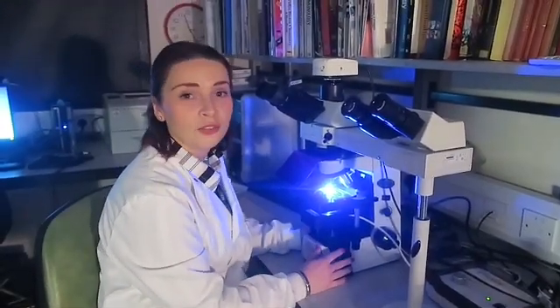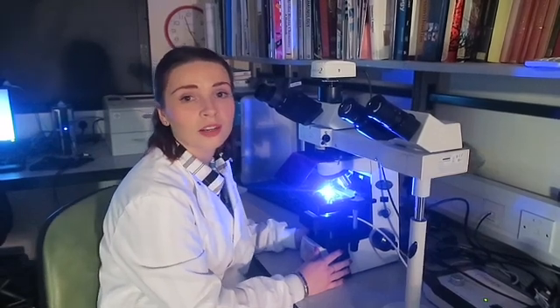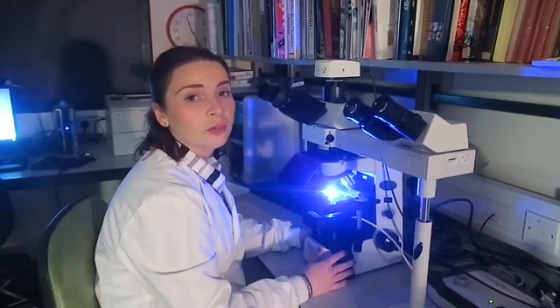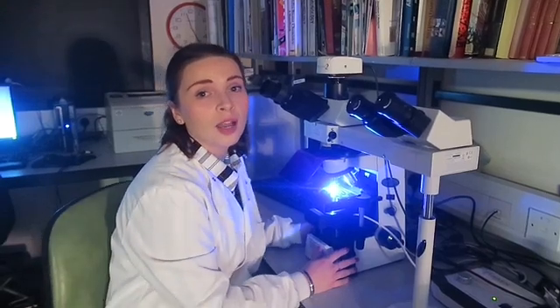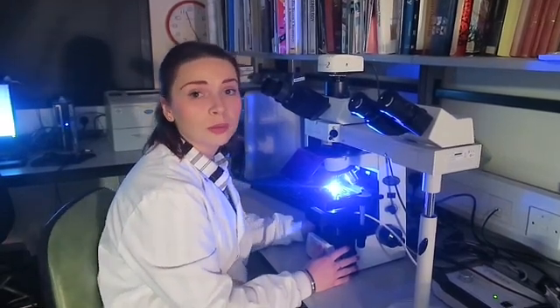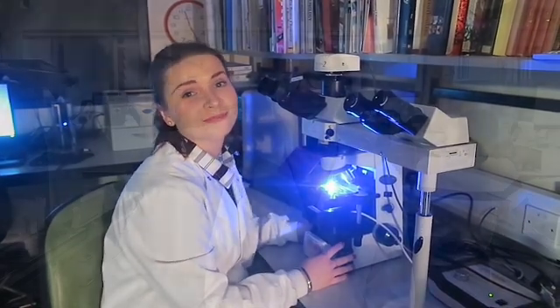So this is our UV microscope and this is what we read all of our slides on. All the indirect immunofluorescence and direct immunofluorescence is read by a biomedical scientist and we will report our results to the requesters.